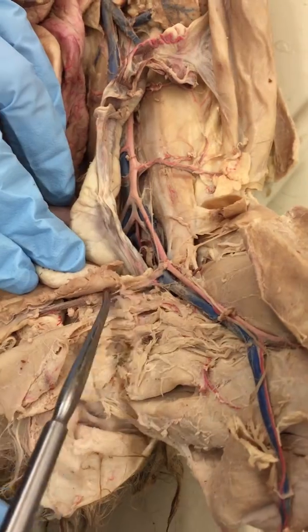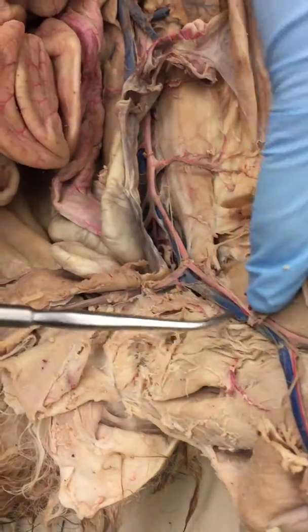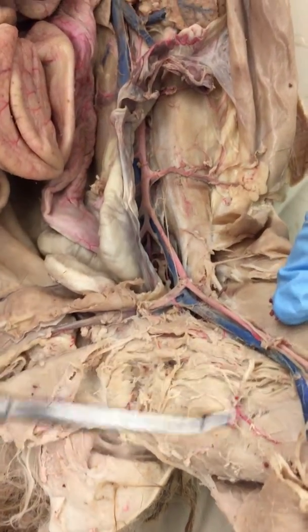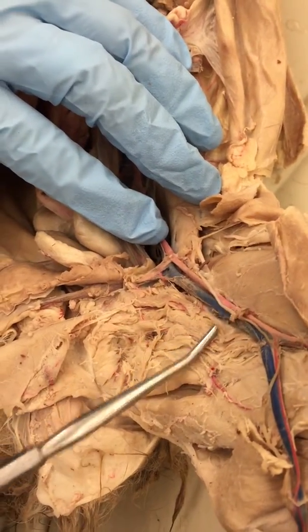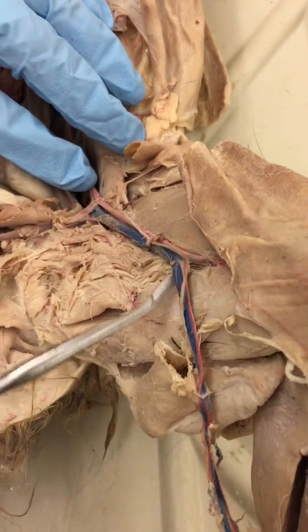That'll be your deep femoral artery and vein. From here to here, you can see the nubs that are supposed to be coming out. You see this residue. From here to here will be your femoral artery and vein. The ones that branch off about here will be your proximal caudal femoral artery and vein. And then this will be your great saphenous vein.